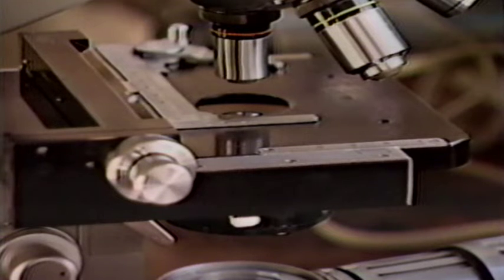To begin the adjustment, focus on the field aperture with no slide in place. Once the slide is inserted, focus the image on the slide as sharply as possible, first by using the coarse focus adjustment knob. Then use the fine adjustment knob until the lines in the image join together sharply. In microscopes fitted with a condenser and diaphragm, the condenser can be moved up until it becomes too bright, and then back down until the best illumination is obtained.